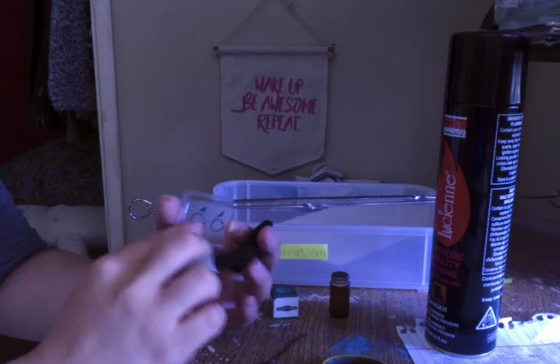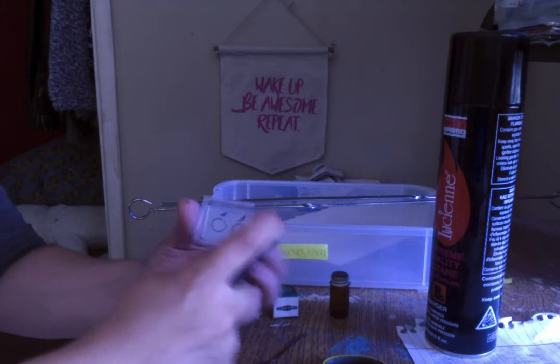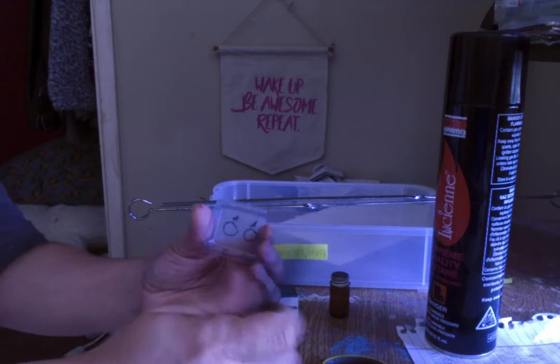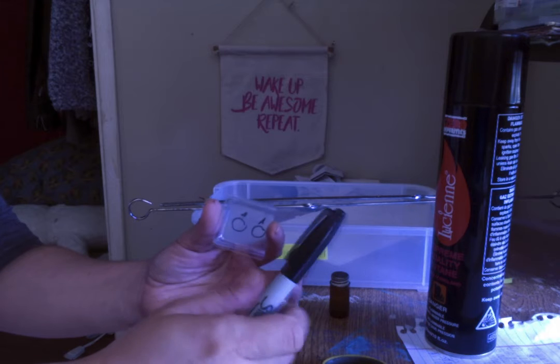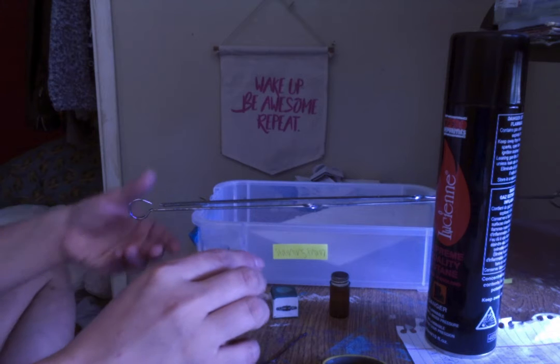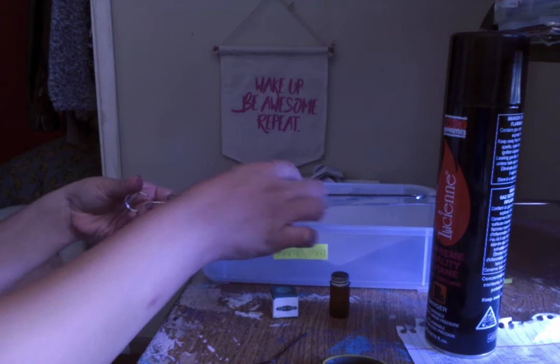And through the front, since it's clear and obviously going on a microscope, you will be able to see what they are while using the microscope. But the marker will not interact or interfere with the bacteria smear itself. So, what we're going to do next is, stick this there, bacteria smear.